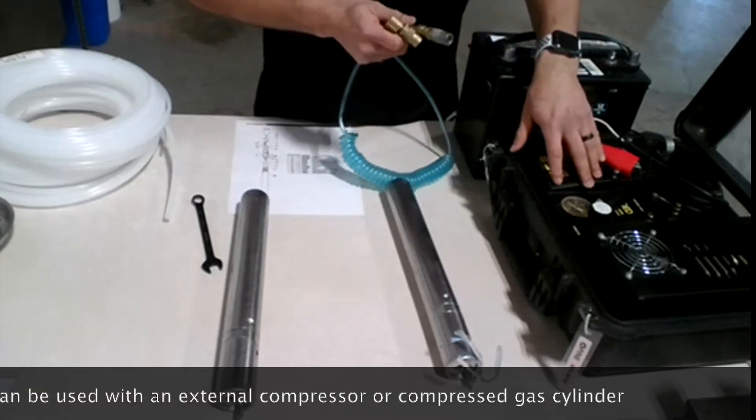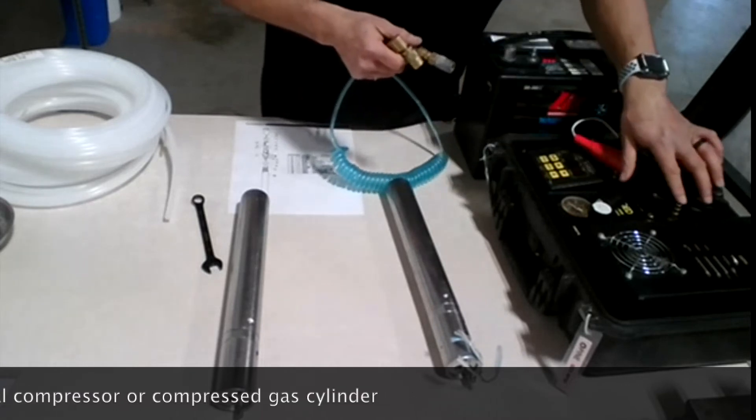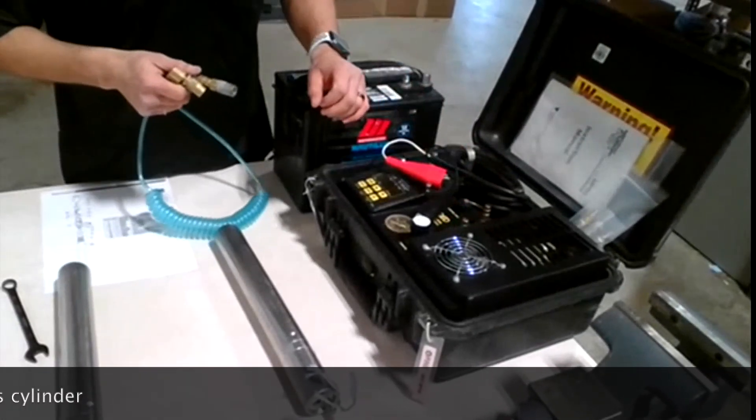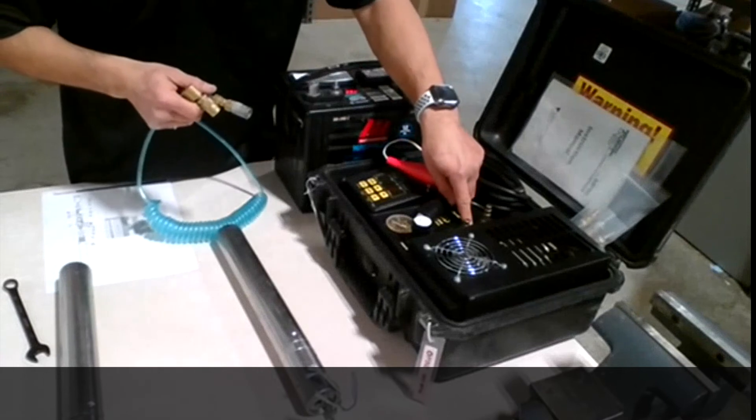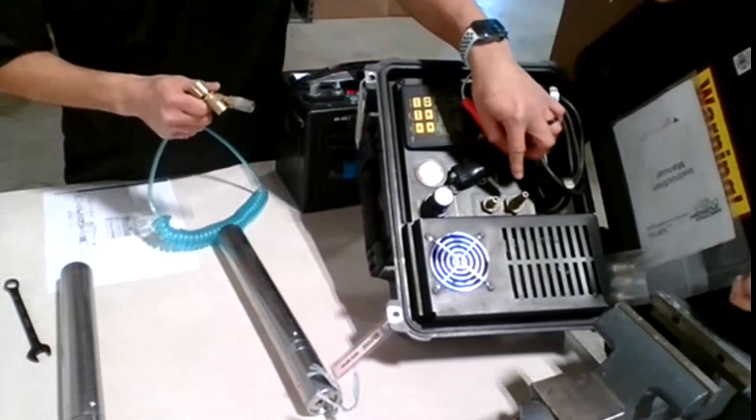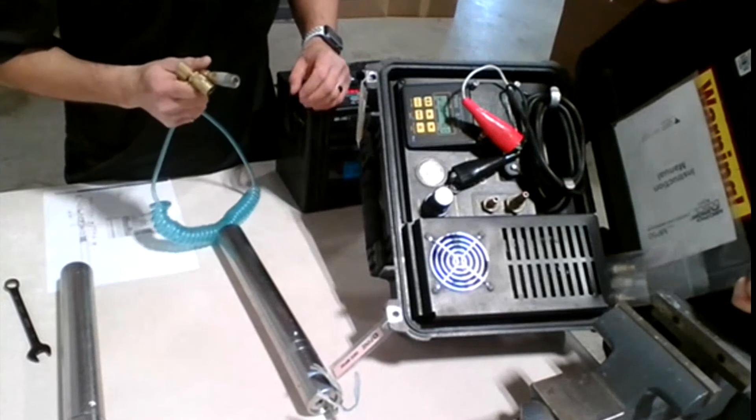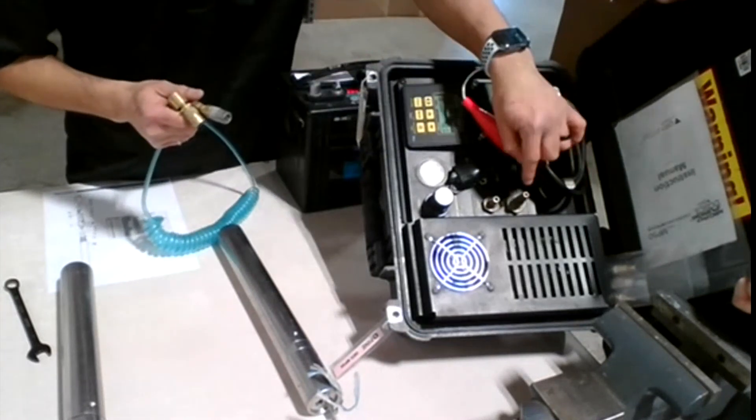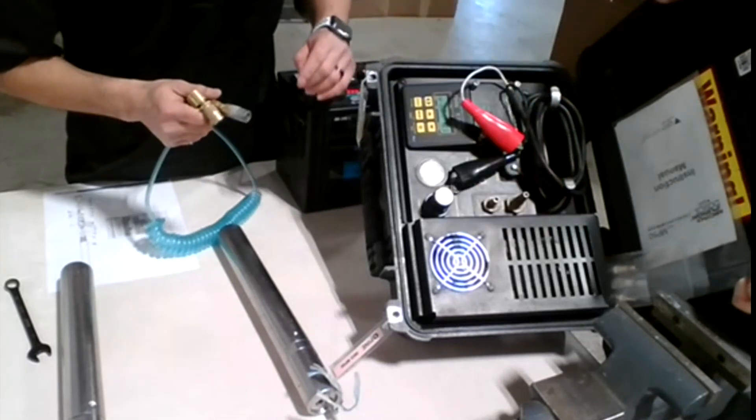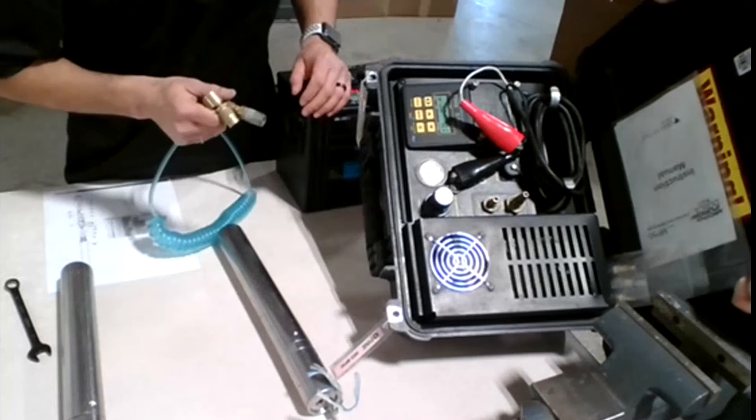So, the controller itself has two ports. There are two ports: first one is air in, and the second one is air out. Air in means the compressor is drawing the air from atmospheric air. That's where the air from the atmosphere goes inside the compressor itself. And the air out is the one that's going out from the compressor to the pump head.